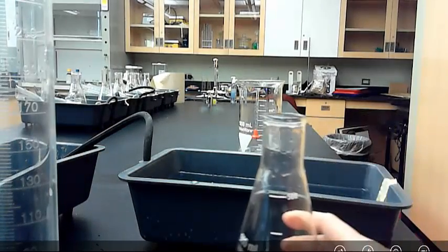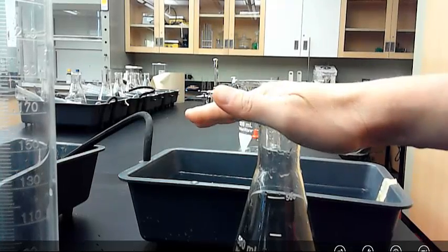The last part of this is I have to fill this all the way up to the top with water. And then I need to measure it, how much water holds when the entire thing is filled to the top. So it's really a pretty quick, simple lab. You can see, although I didn't wait the time, and I didn't fill this up the second time, you really can get through it quickly, but you need to know what you're doing. So hopefully that at least gives you a heads up.